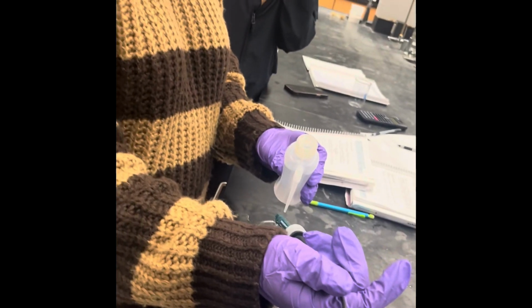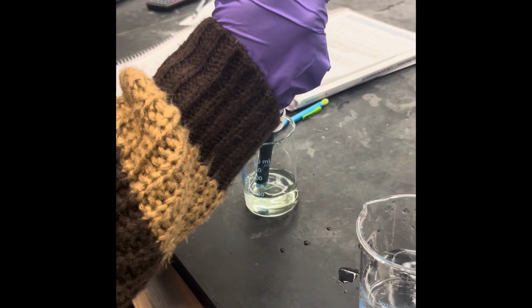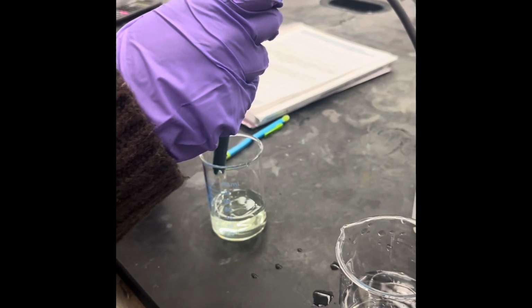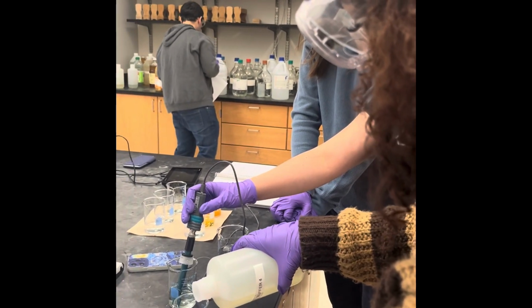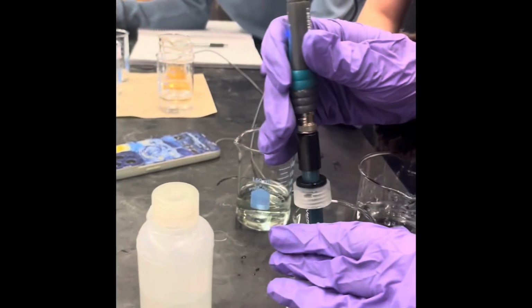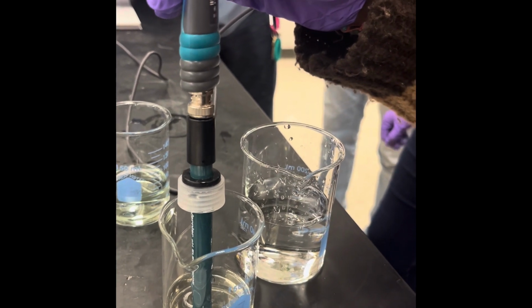First, we collected our solutions and placed them into 6 different beakers. Then, we obtained a wash bottle containing deionized water as well as a waste beaker. We obtained pH buffers 4 and 7 for when it became time to calibrate our pH probes. As you can see here, we are calibrating the pH probe with the buffers in order to take the pH values of each solution. The solutions were hydrochloric acid, acetic acid, sodium hydroxide, ammonium hydroxide, apple juice, and orange juice.